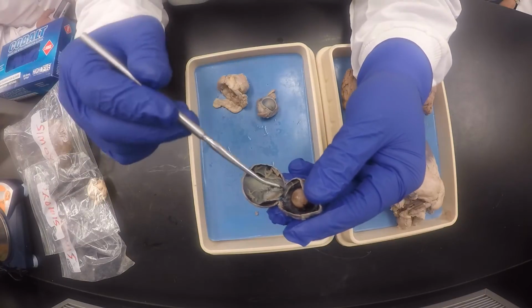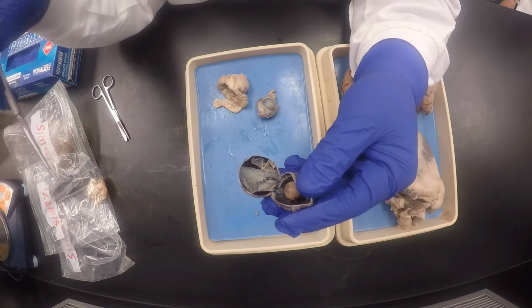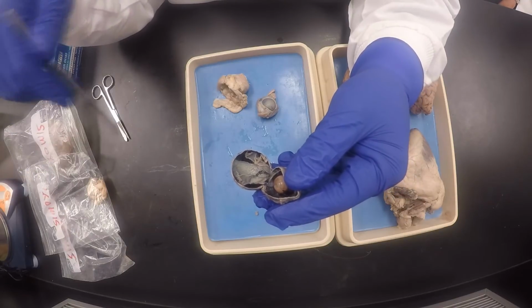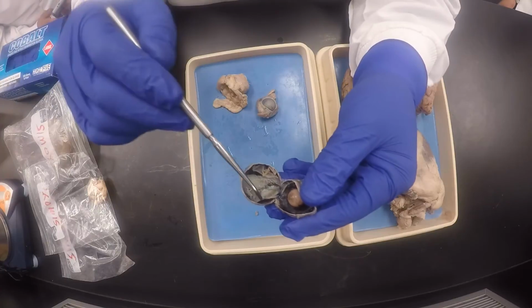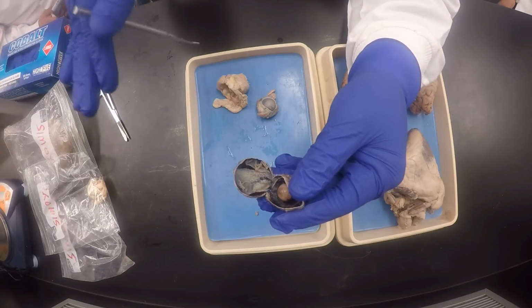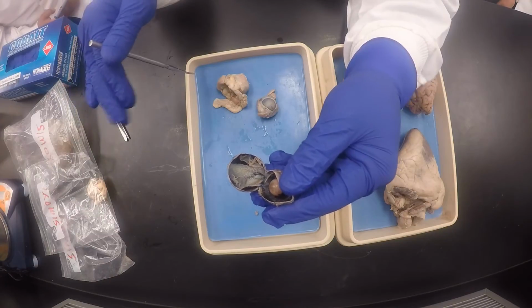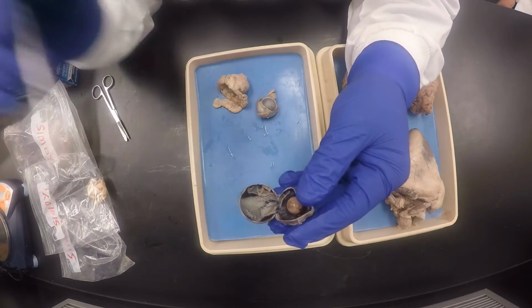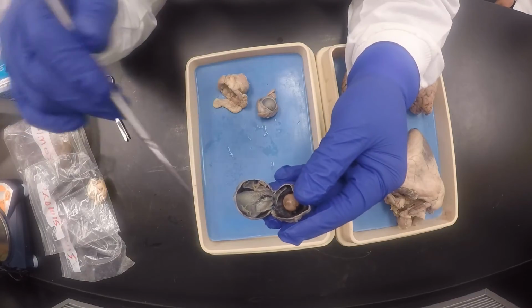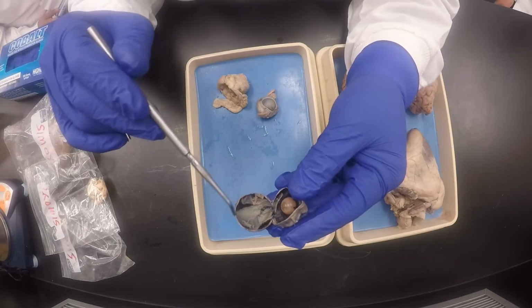It has lots of melanin that protects, so the light doesn't enter, so it's black, just like you put black curtains in the movies if you're watching in the afternoon, so light doesn't get in. Or you don't want the light to escape, you want the light to be harnessed and focused on the macula so you can see. Plus it protects against the UV light. The melanin protects against the UV light, so it's dark like that.